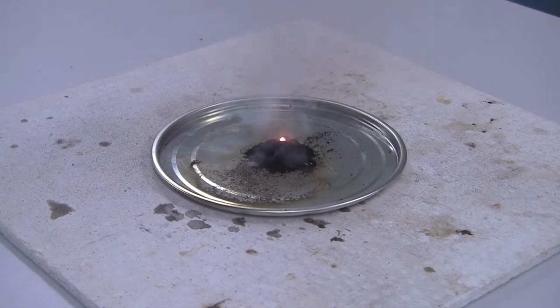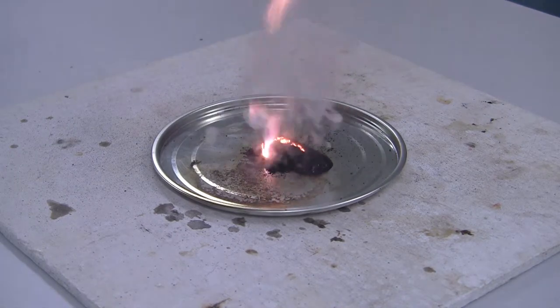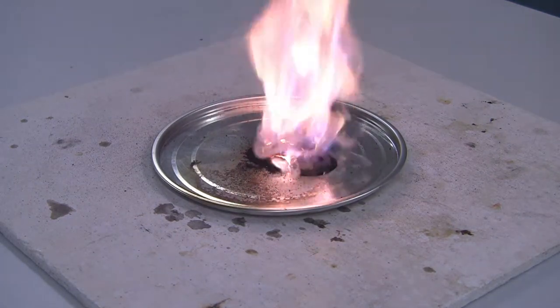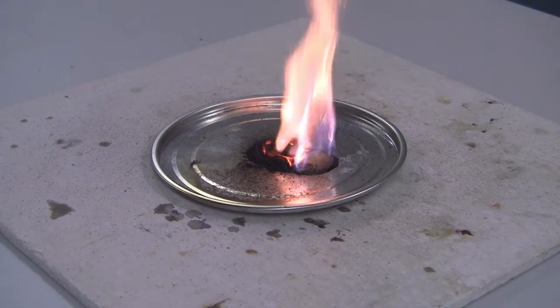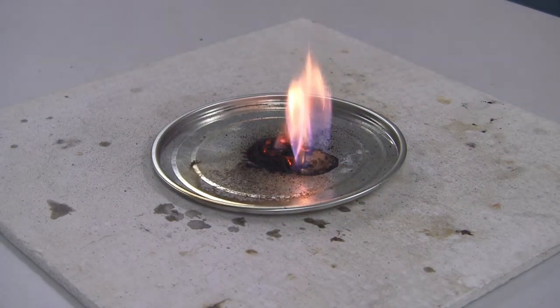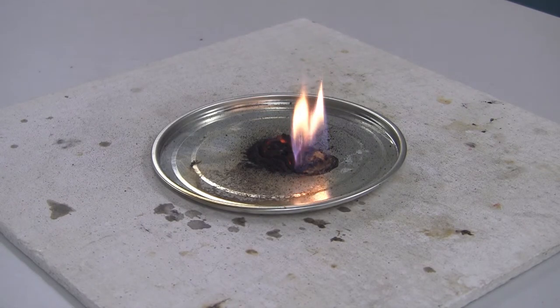It's a light lilac flame which is signifying the presence of potassium. So you can ask your students, look at that color flame. If they've seen potassium in a flame before, hopefully they recognize the color.